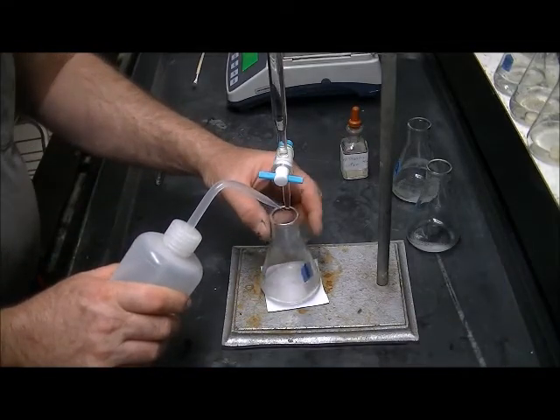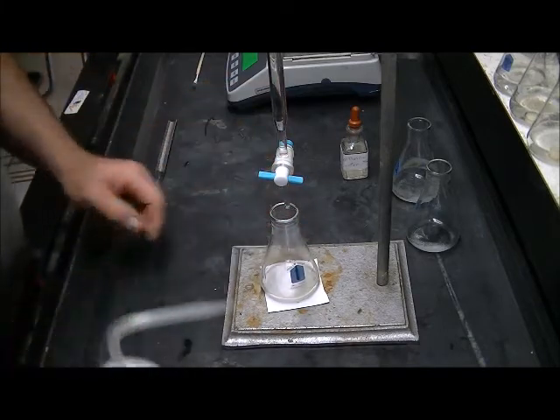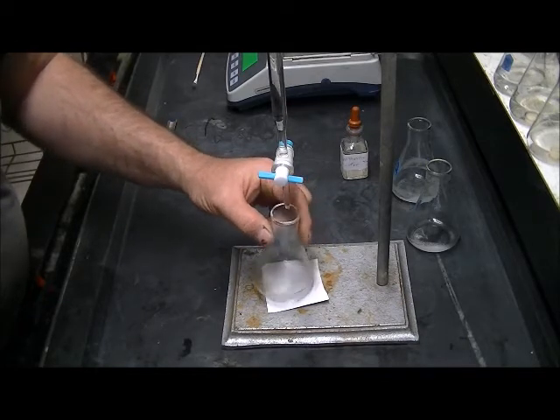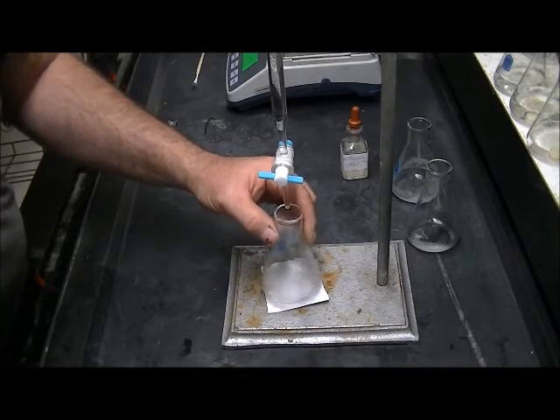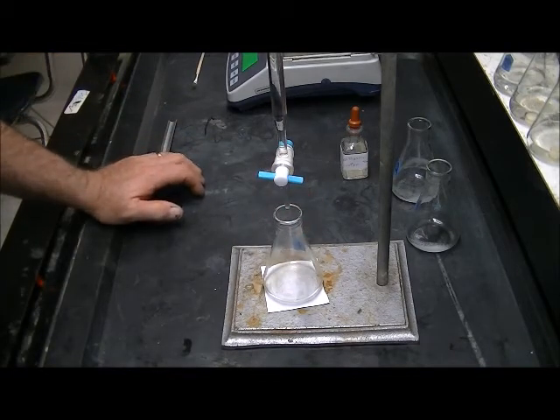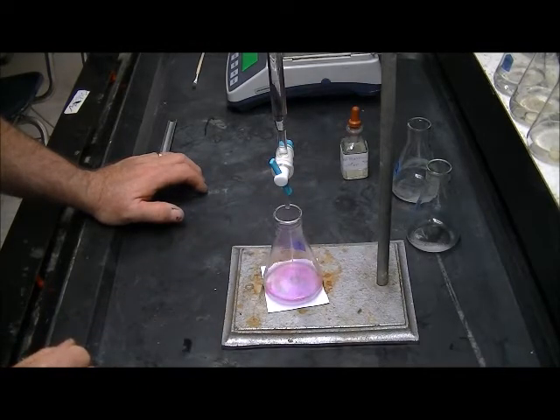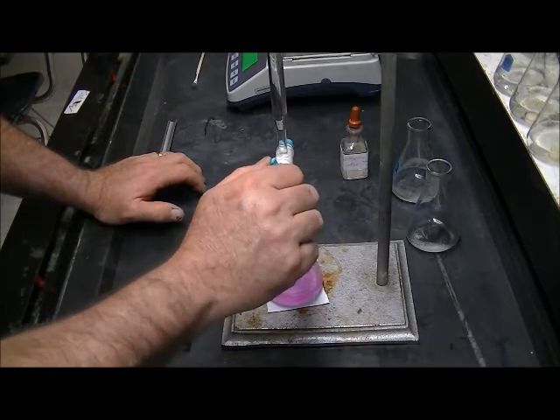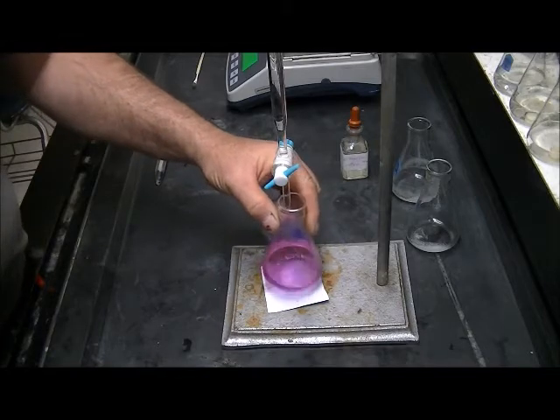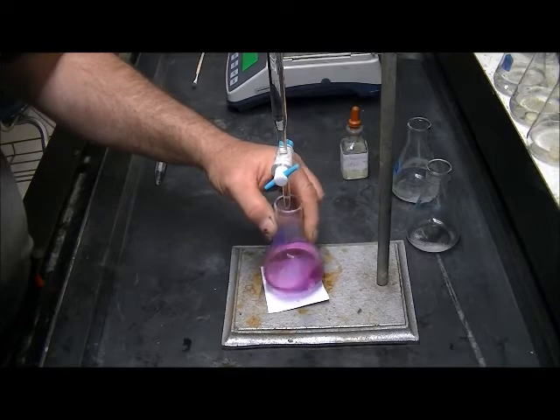I'm adding a little bit of water to help dissolve the solids. The potassium hydrogen phthalate has rather large crystals, so this titration can sometimes go rather slowly. I'm going to run in quite a bit of titrant to start with — down to about 24 or so. There's my intense pink. We don't want it to be that intense. That should fade as the solid dissolves.